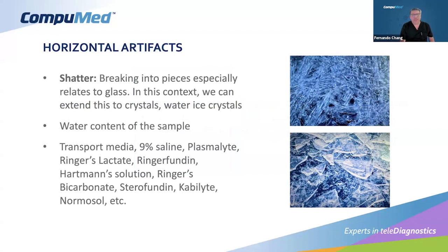Shatter is this problem that we have in frozen section and the cryotomy specialty, where we can see something like what happens when you break glass. And this glass breaks out into a lot of fragments. In the context of frozen section, when you introduce temperature into the tissue, there is ice formation. That creates water ice crystals. You can see this pattern of water ice crystals in the picture on the right, happening inside the tissue, embedded in the tissue.